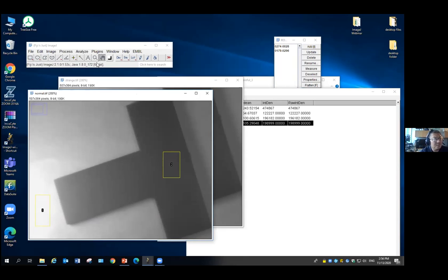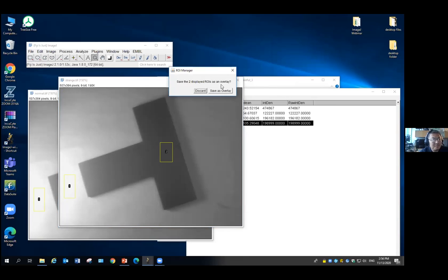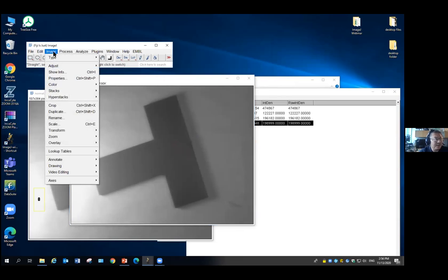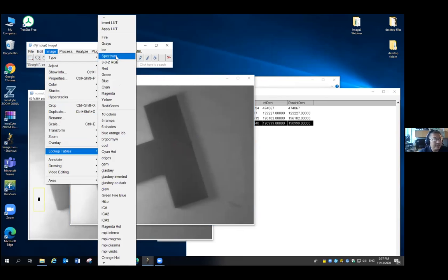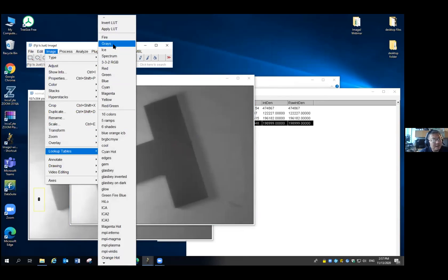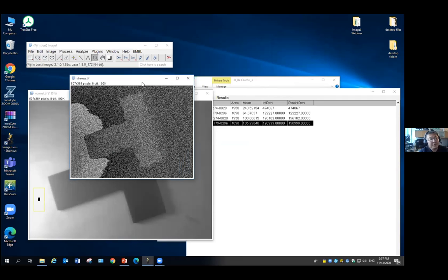So the problem with this strange image is, if I now force this one to show me what is real in grayscale, I go to the image lookup table. I force it to show me in grayscale. It will show what it actually is. If the dark pixels show up black and the brighter, stronger pixels show up white, it will be something like this.